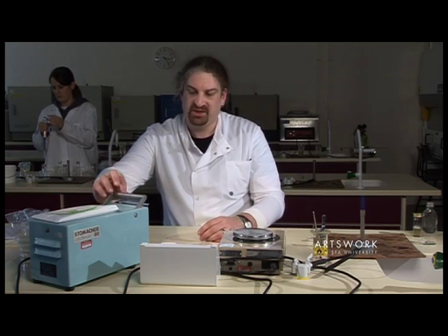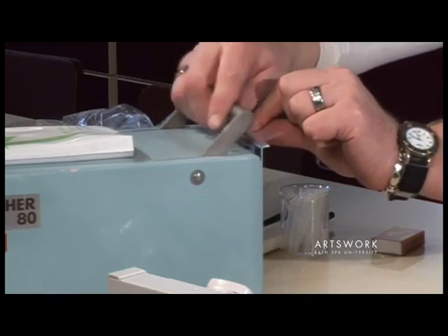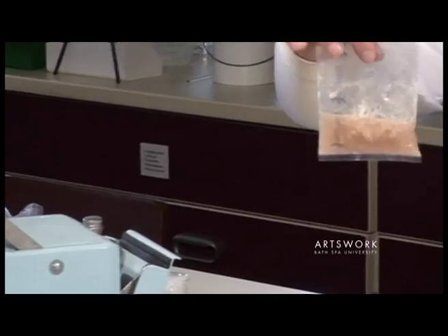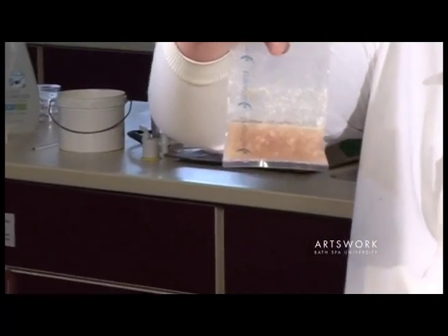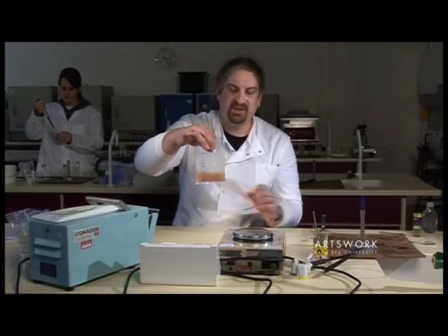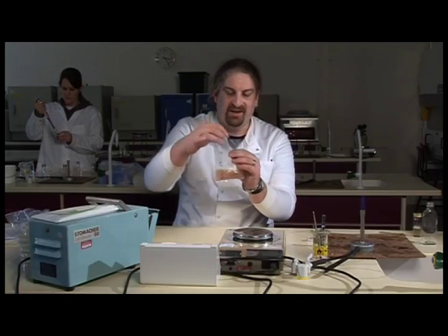Once the sample has stomached for one minute, hold onto the bag, push back the handle to open, and then what you've got there is the sample and the liquid fully mixed together. We can then put that through our serial dilution technique and plate them out.